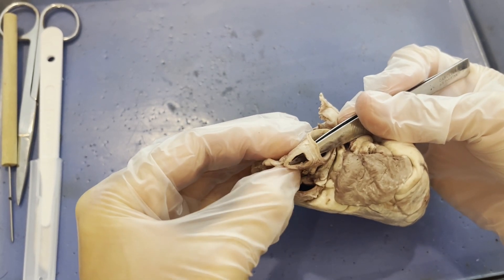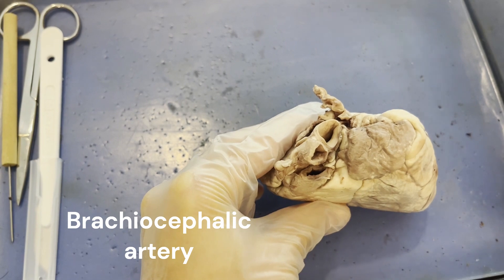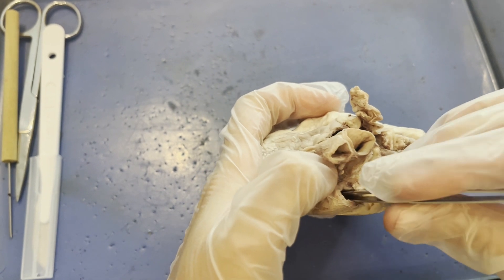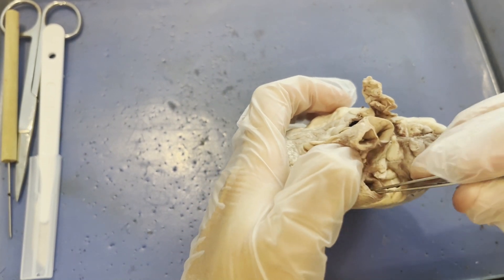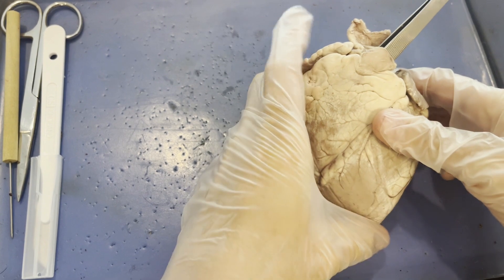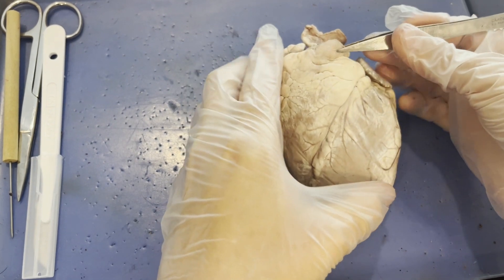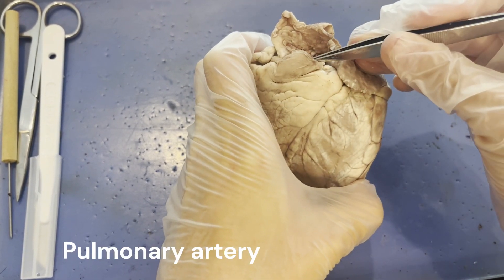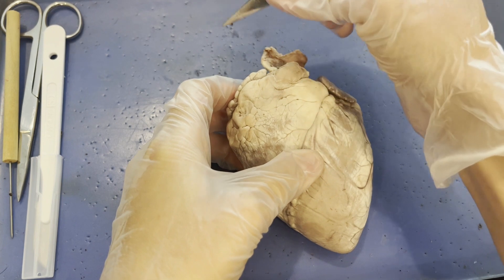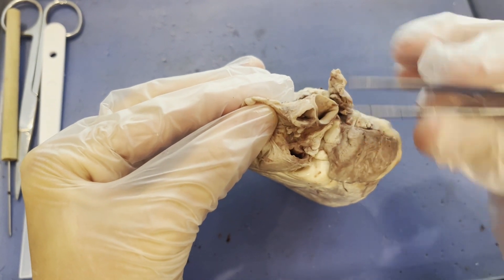This pathway coming off the aorta right here — you can see these two blood vessels are connected — is the brachiocephalic artery, just a branch off the aorta. In front of the aorta is probably the most anterior blood vessel. If I push my forceps down it, I end up in the right ventricle. That's because when the right ventricle contracts, blood comes shooting out of it — this is the pulmonary artery, which sends blood out of the heart to the lungs.